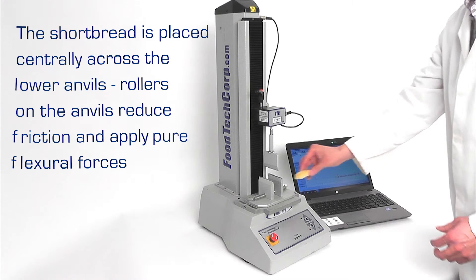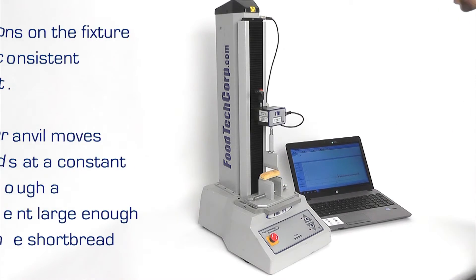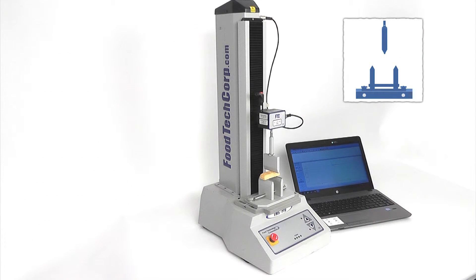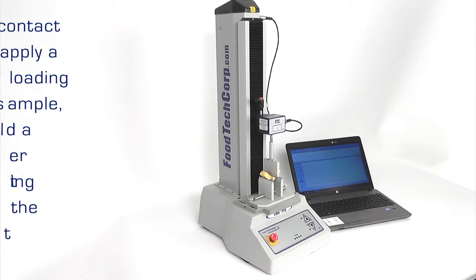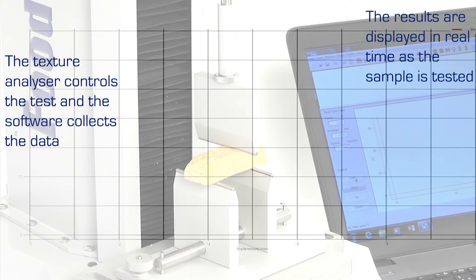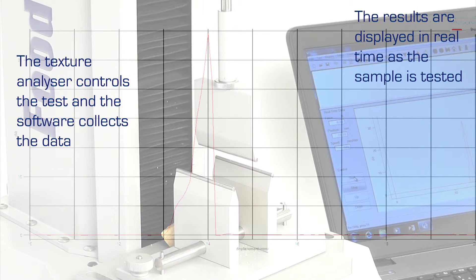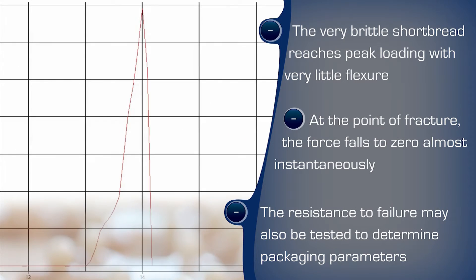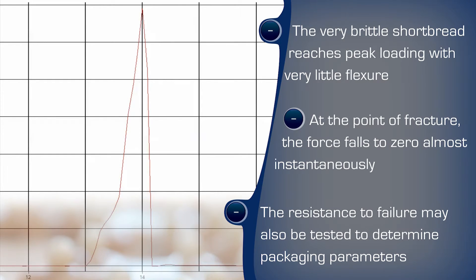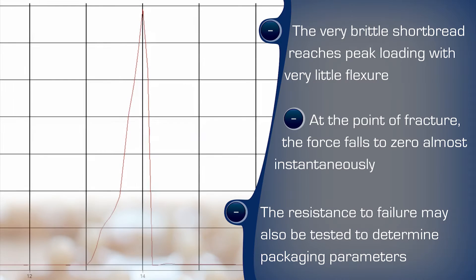The test procedure will lower the crosshead to a distance that guarantees the shortbread will be fractured. The three anvils are tipped with rollers to minimize friction and allow pure bending with minimum shear. The sample is placed across and supported by the two lower anvils, and the upper blade-shaped anvil is lowered onto the center of the product, causing it to either flex initially or snap straight away with very little deformation. Real-time graphing clearly shows the behaviour of the sample under test, and features of the curve can be identified which indicate ideal or undesirable sensory characteristics, with calculated values correlated to preferred quality benchmarks.